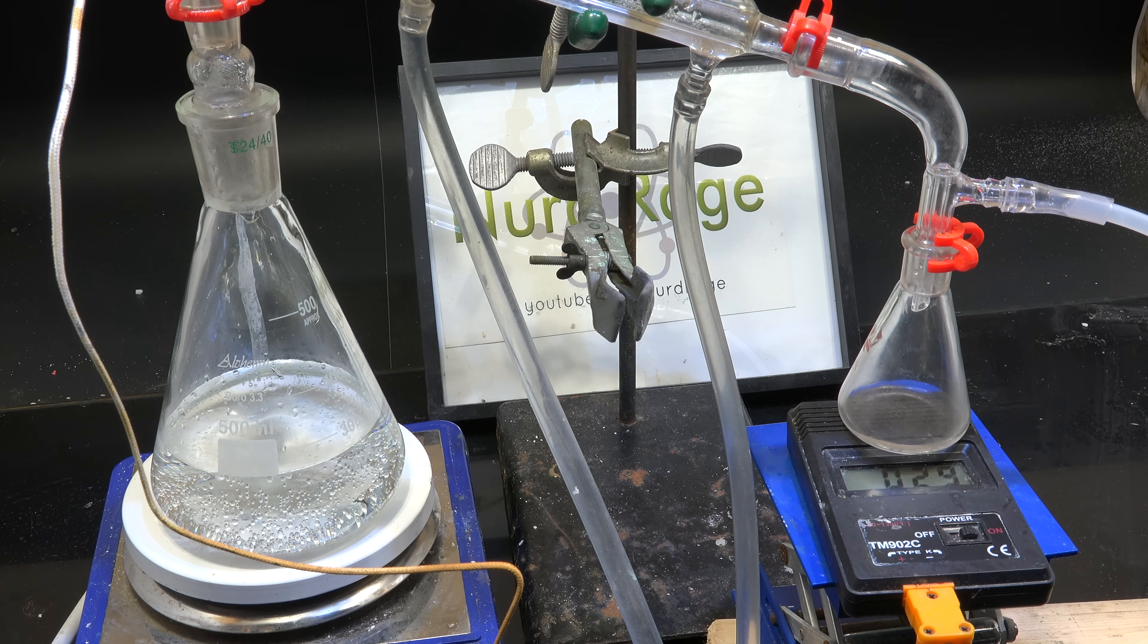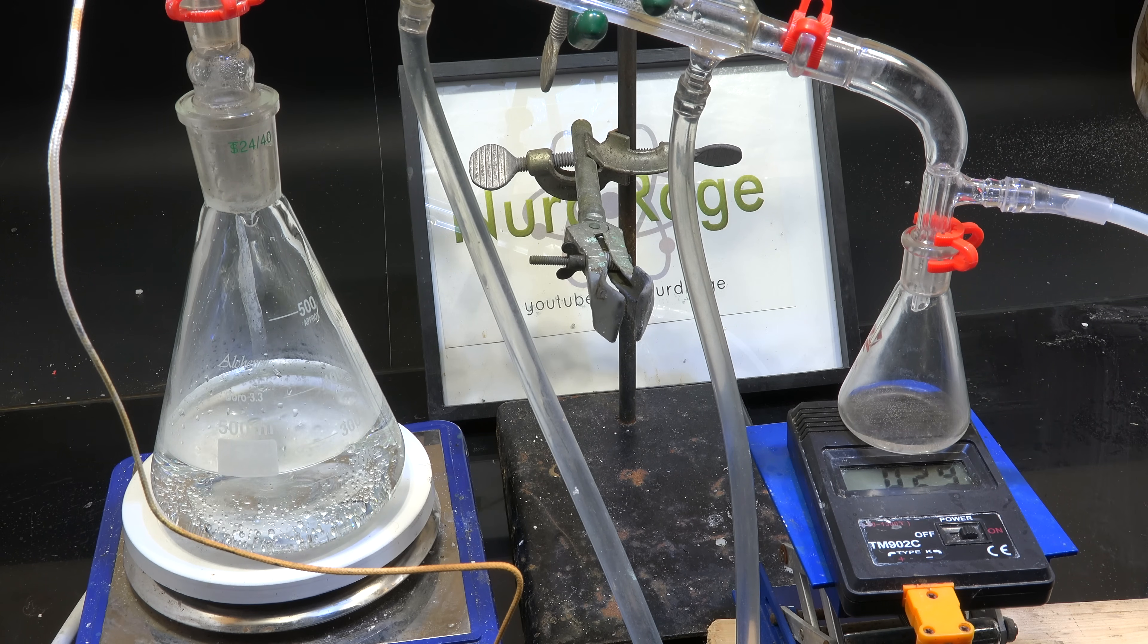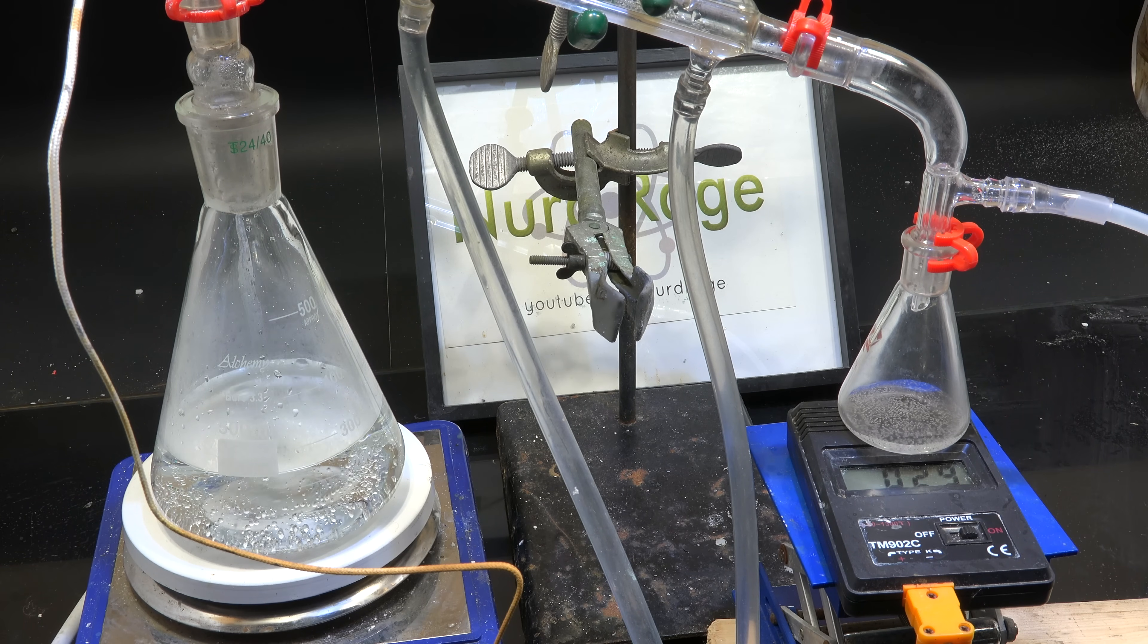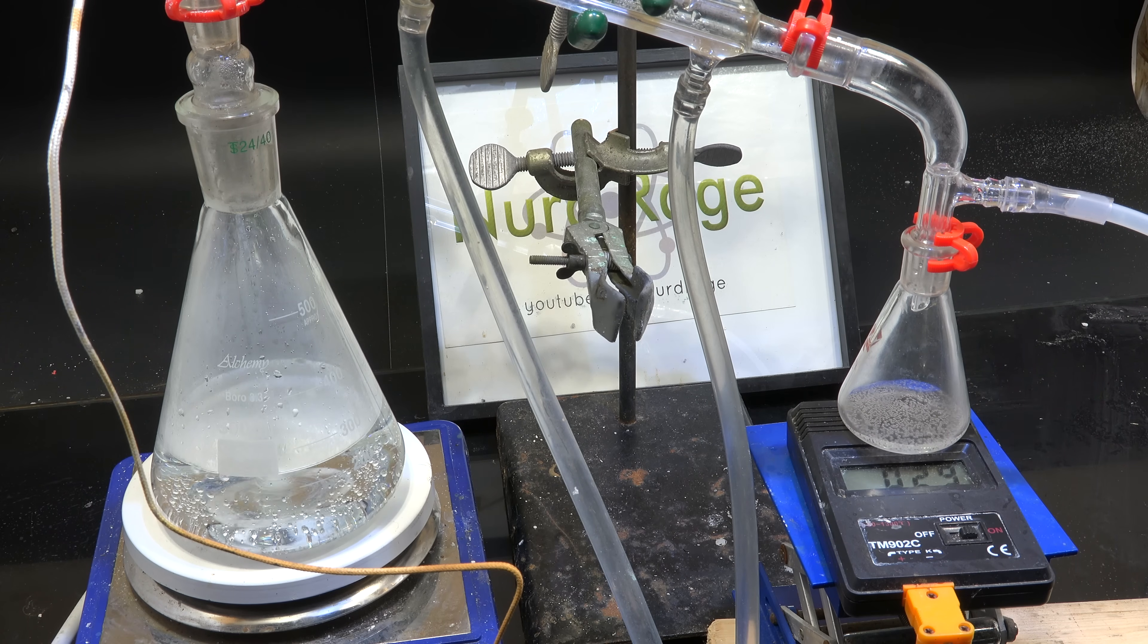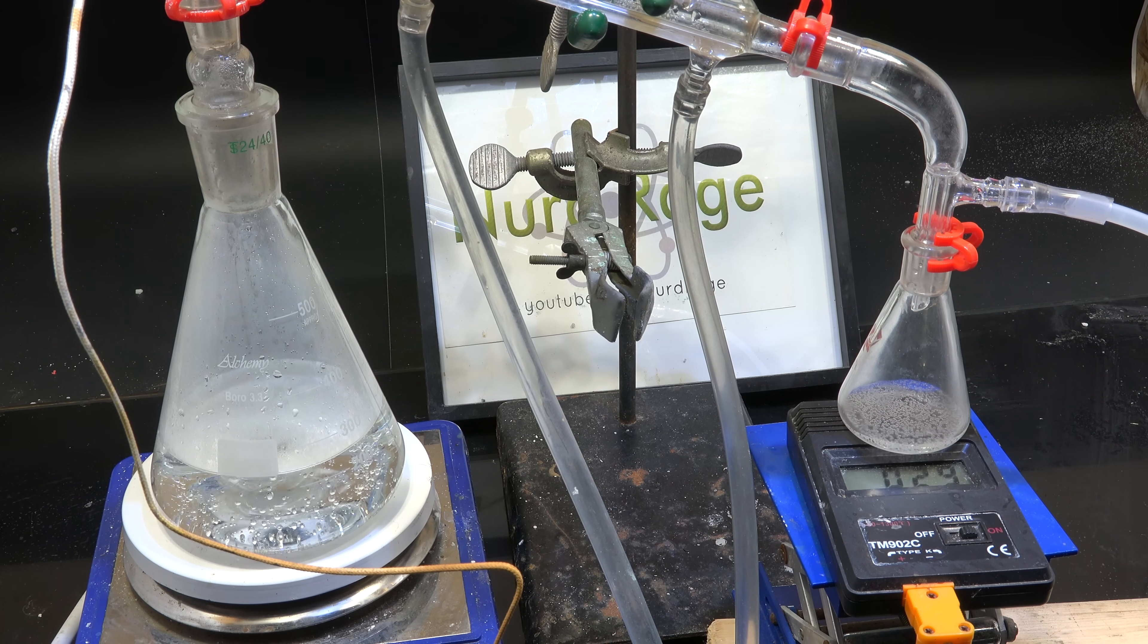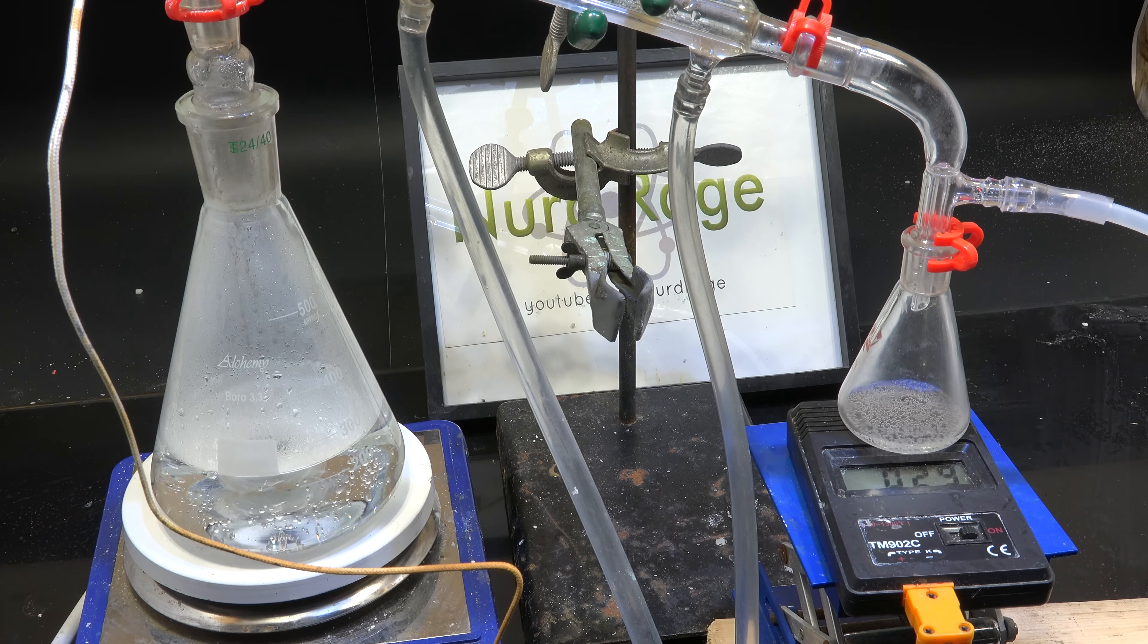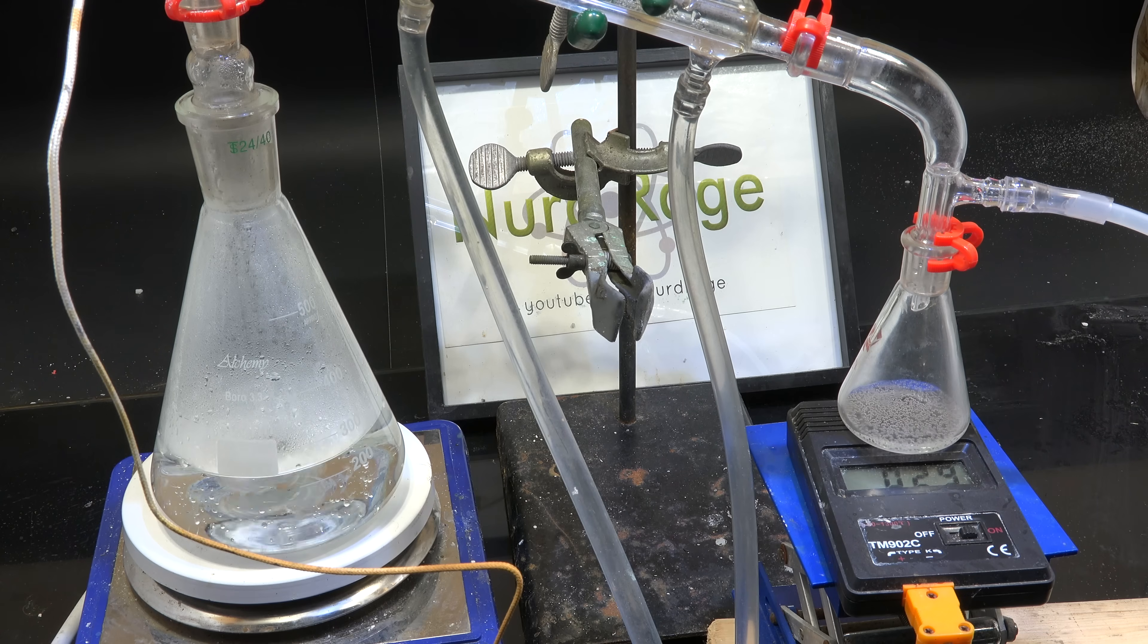Let me turn on the pump as well as turn on light heating on the hot plate. Now at first we're going to see some bubbles and vapor but that's just because of the change in pressure. Gases dissolved in the water are now coming out and not actually boiling. We'll know we're distilling when we see actual drops of water falling into the receiver. My receiver has a bit of water already because I was running some tests before. Now all we do is wait.